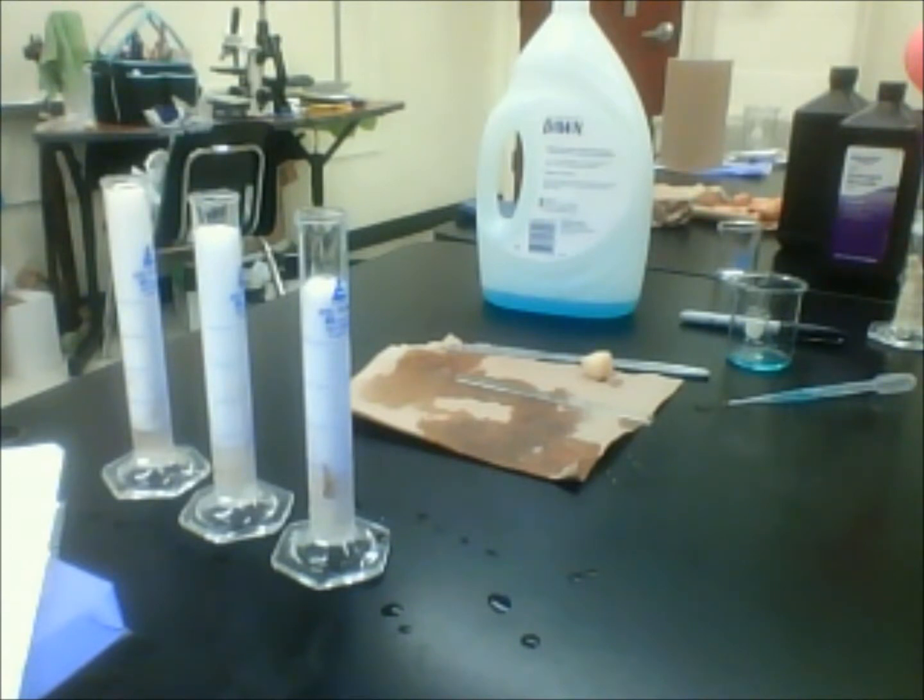And this one I know is going to go past it. Oh my gosh. We still have about another minute and a half on that one. About a whole nother minute. Alright, so we're at the first 5 minutes.